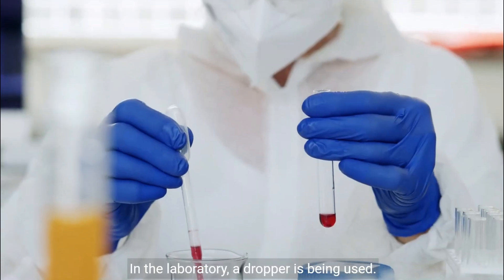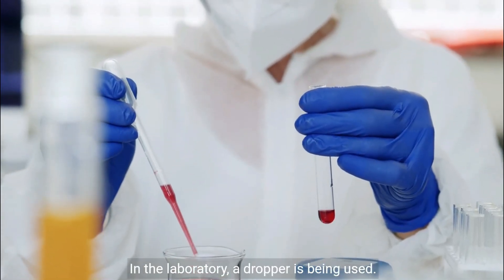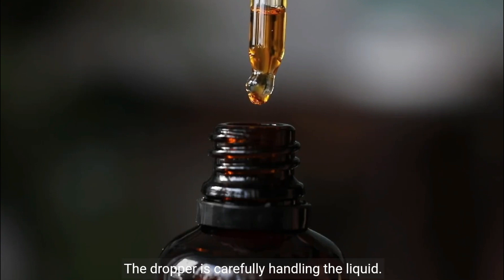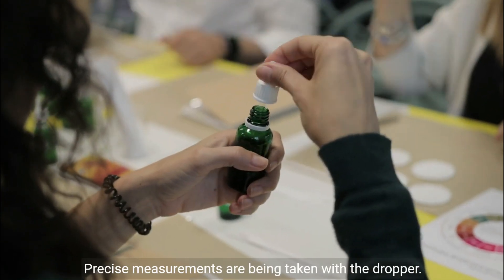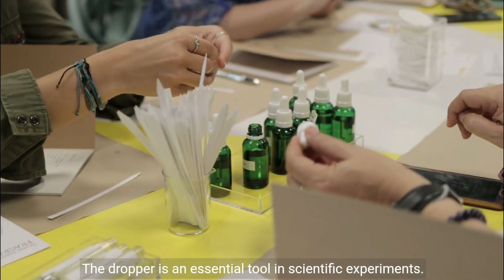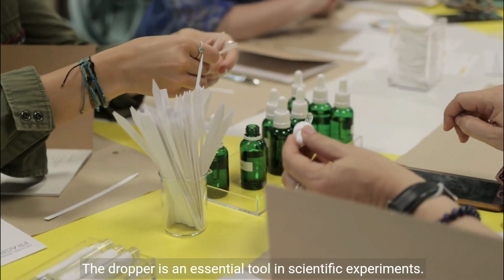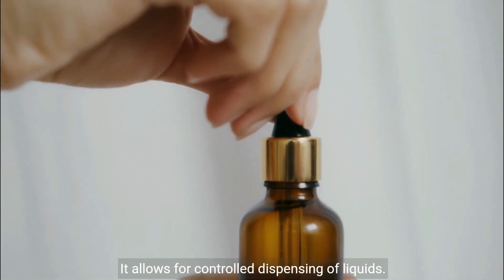In the laboratory, a dropper is being used. The dropper is carefully handling the liquid. Precise measurements are being taken with the dropper. The dropper is an essential tool in scientific experiments. It allows for controlled dispensing of liquids.